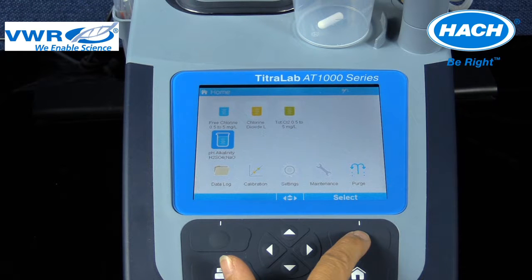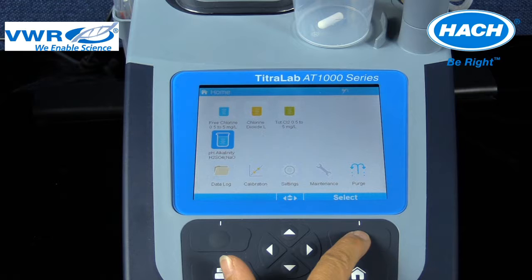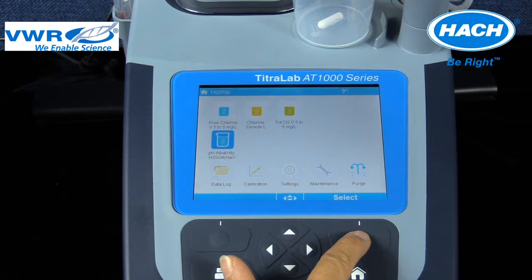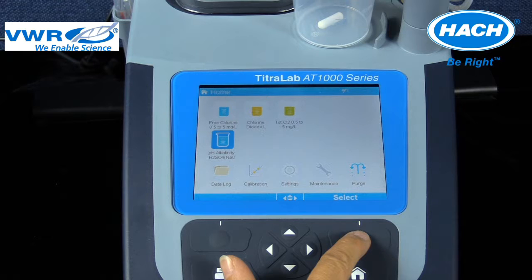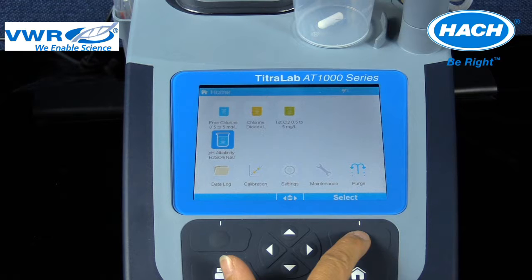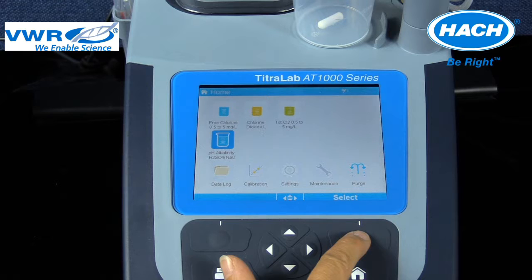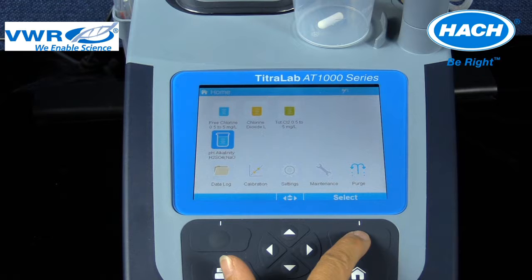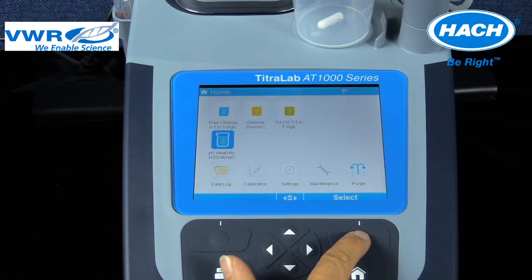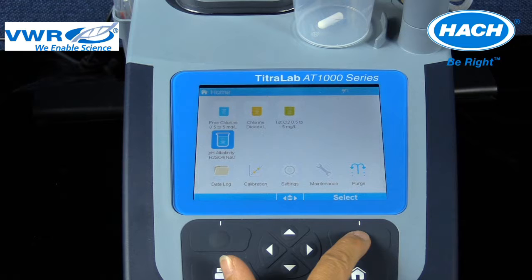There are several application notes that include a recommendation to calibrate the electrode. The pH alkalinity application, AP0001.AT1102, is a good example.